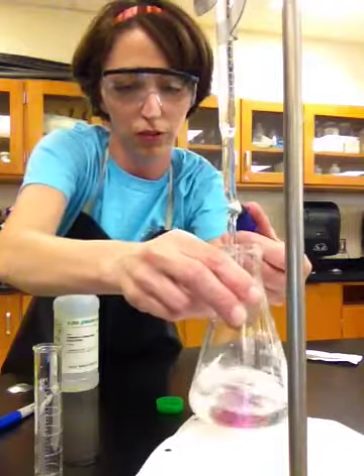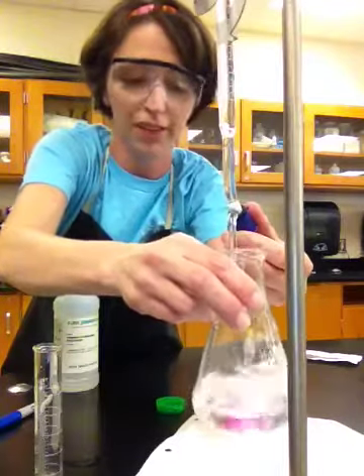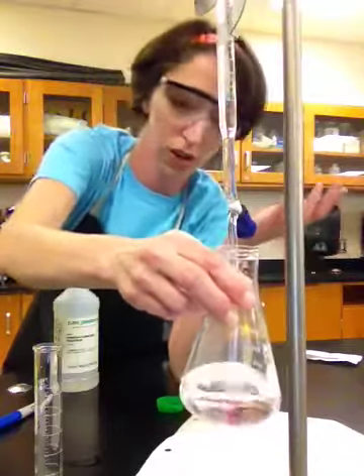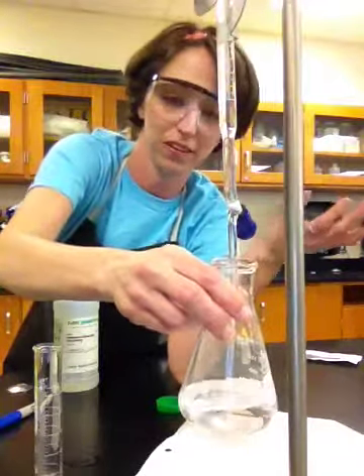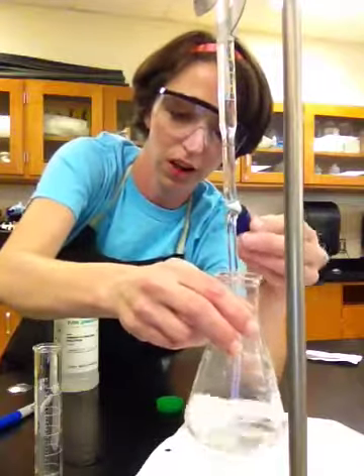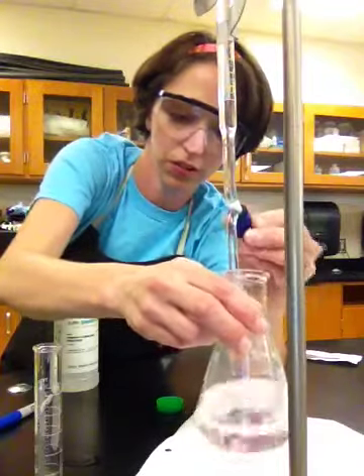Okay, so we're getting closer, getting closer. Now, if you guys were really doing this titration, one trial is never enough. First trial is kind of like practice. You usually totally mess it up. Okay, and then when you do the second and third trial, you get a lot better data. So I'm going to start slowing down.